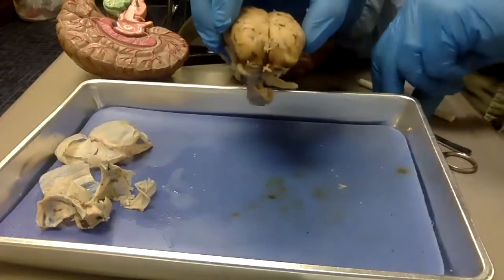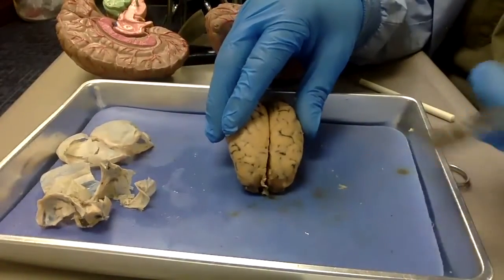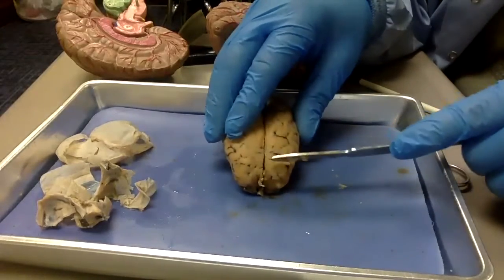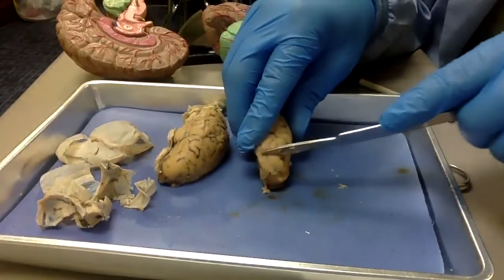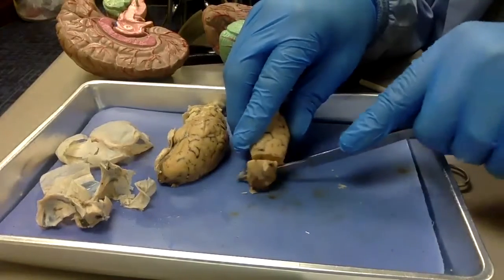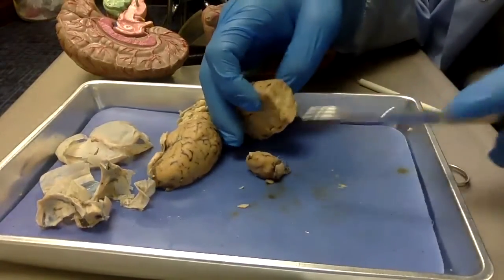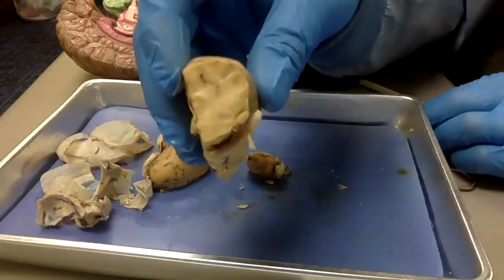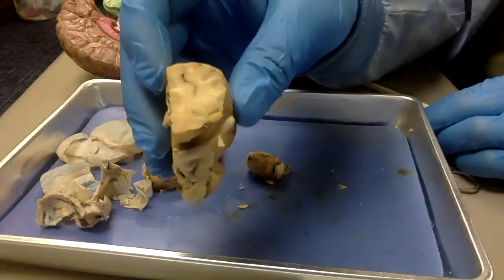So let's take a look at the inside of that. They've learned since then that lobotomies don't actually work and no one does them anymore. But if we were to cut that frontal lobe off, what would we really see? It's quite a color difference. It looks like we're looking at the branches of a tree.